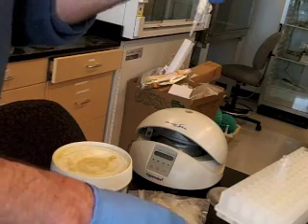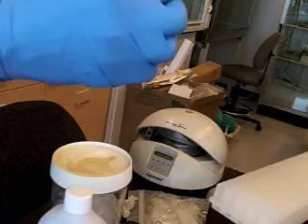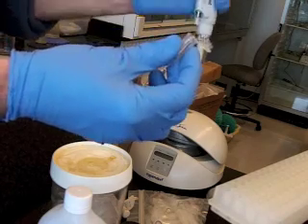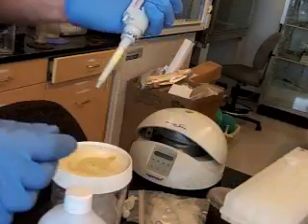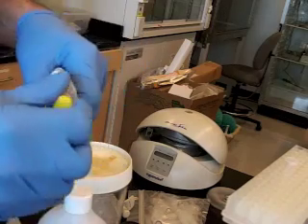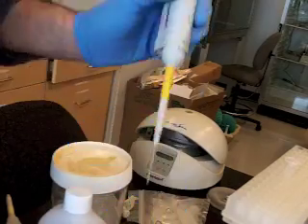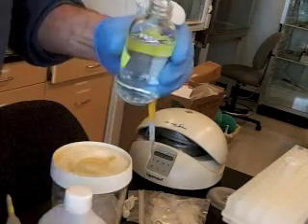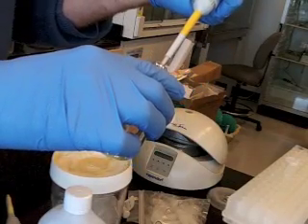So you always want to, if possible, lift tubes up and watch yourself pipetting in, and then watch yourself pipetting out. You squirt it out, then you push down, you get rid of all of it, get rid of that tip, and we could cap it like that temporarily, because now we're going to put a smaller volume in, like this. So let's say we're going to put 4 microliters in, and it's good to eject the 4 microliters into the bigger volume. So let's say we're going to do this, and uncap this, and push this down to the first stop, and then just gently lift up.